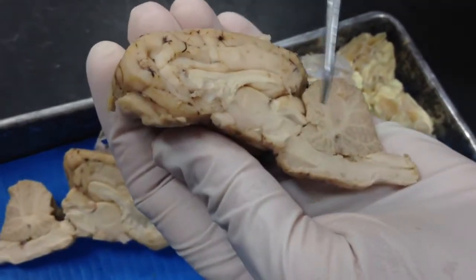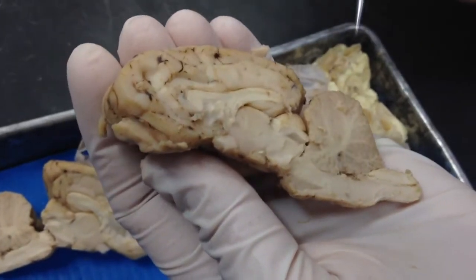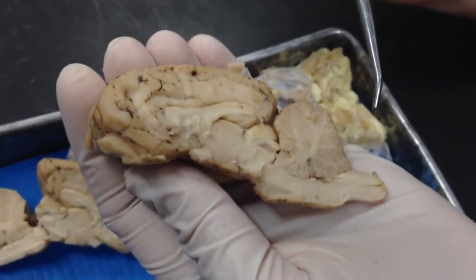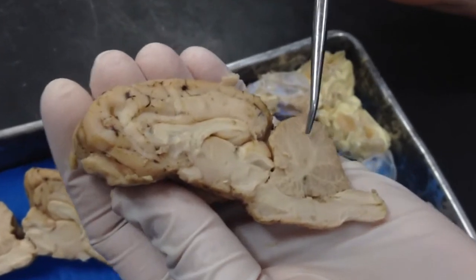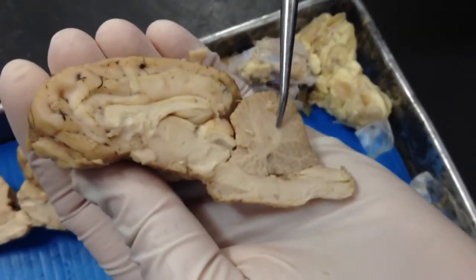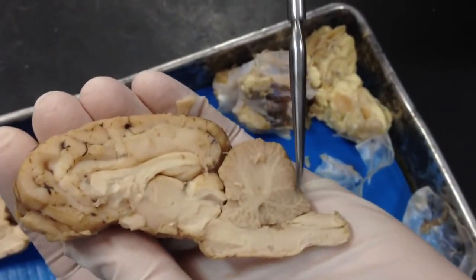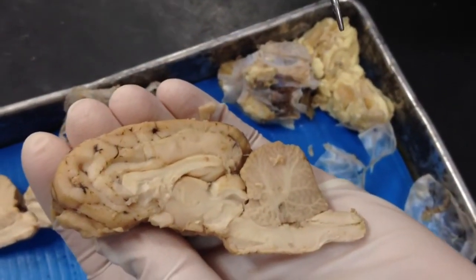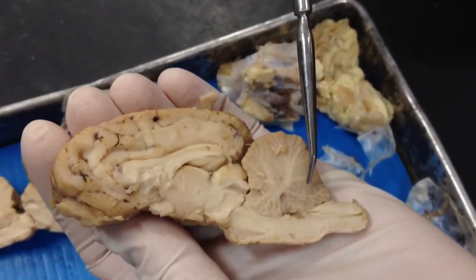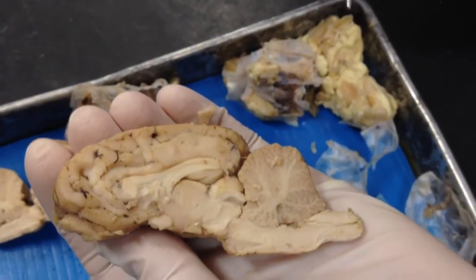Fourth ventricle — is it right here? Arbor vitae. The neural cortex — the cerebellar neural cortex is the outer gray matter. The folia are the little folds of the outer gray matter.